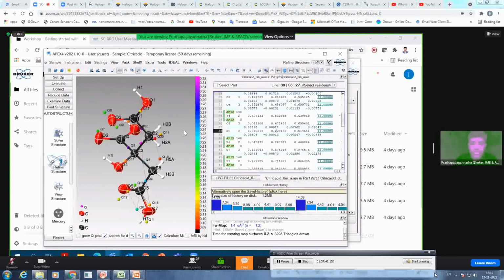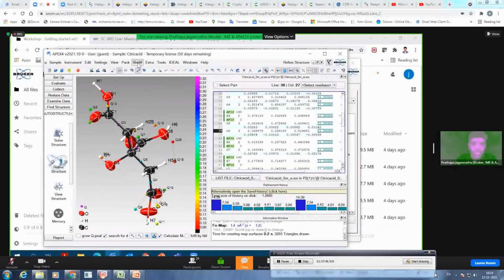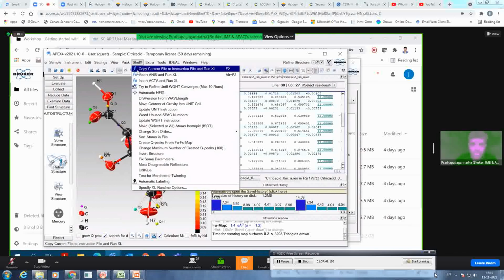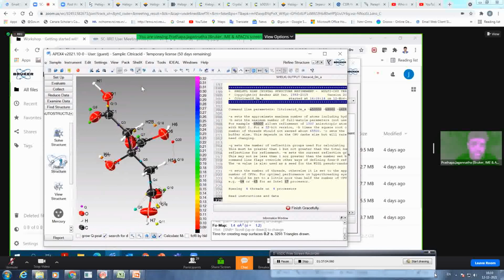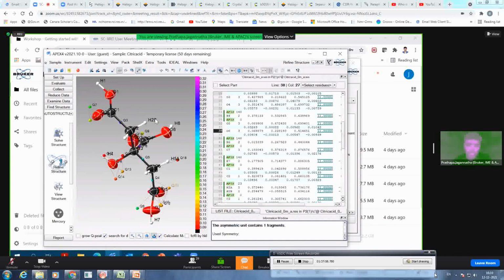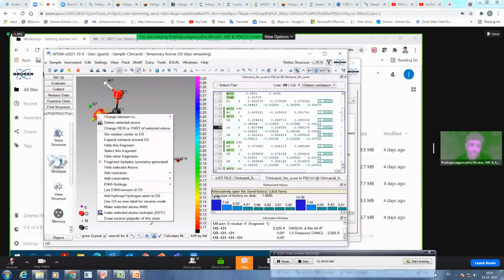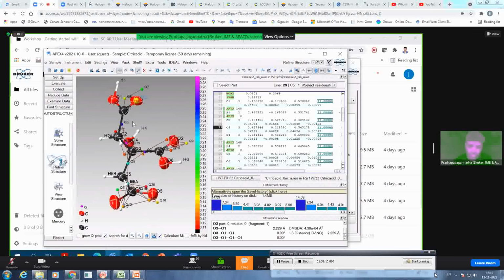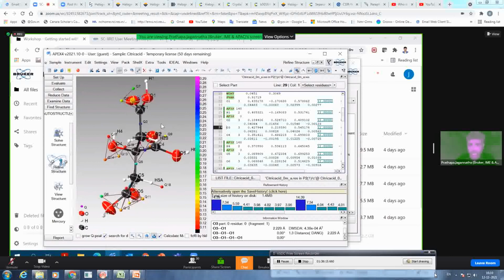Okay, so this is how you refine your structure, and then you can also do further finalizing of your structure, like try to refine until the weight converges. If there is any hydrogen missing, please look carefully and add those hydrogens. You can also click on that particular atom and then directly add a hydroxyl hydrogen or whatever you want, or the methyl group or amine group. You can add whatever hydrogen is missing.